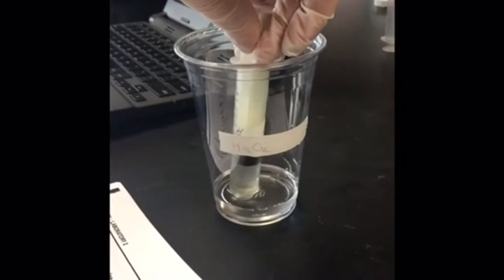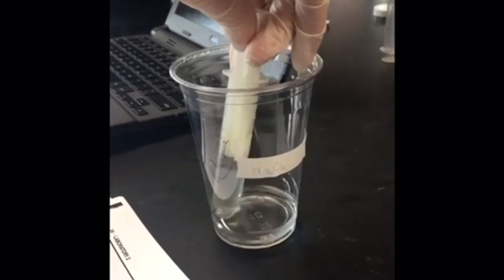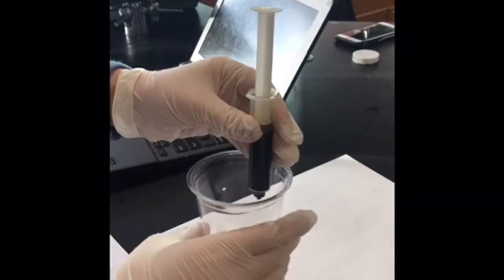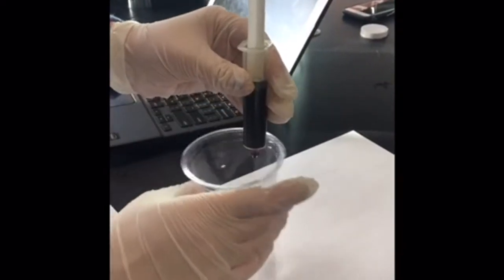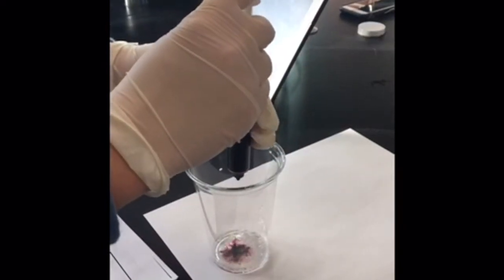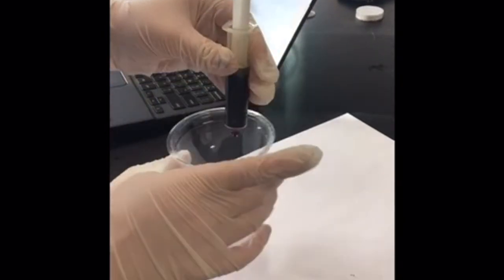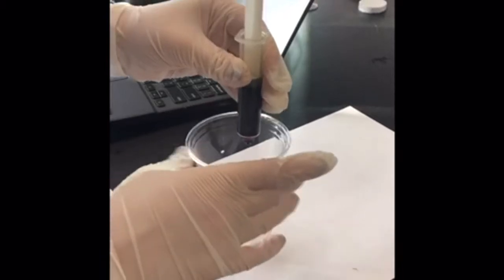After that, we added 1 milliliter of water and then 10 milliliters of sulfuric acid, using extreme care when handling and pouring. After mixing that solution, we removed a 5 milliliter sample and put it in another beaker. After that, we added some potassium permanganate 1 drop at a time, gently swirling the solution until it maintained its color, either a brown or a pink. Then, we checked the amount of potassium permanganate we used and recorded it in our data table.